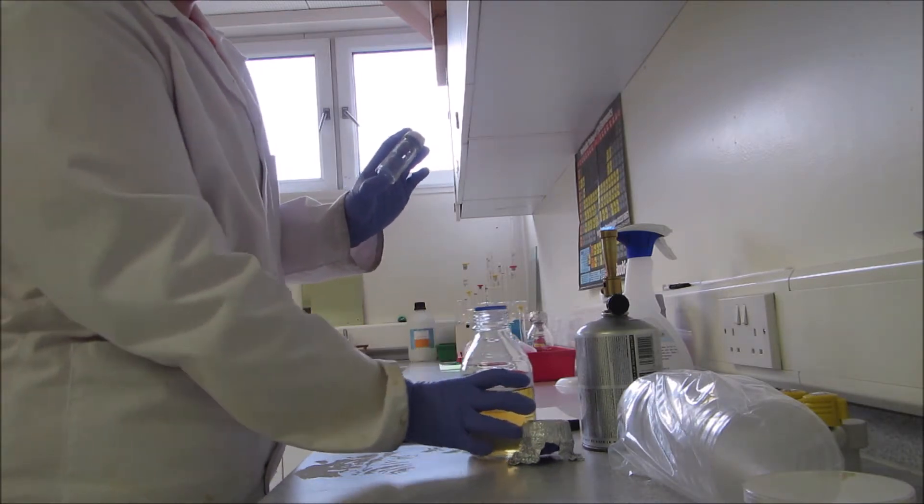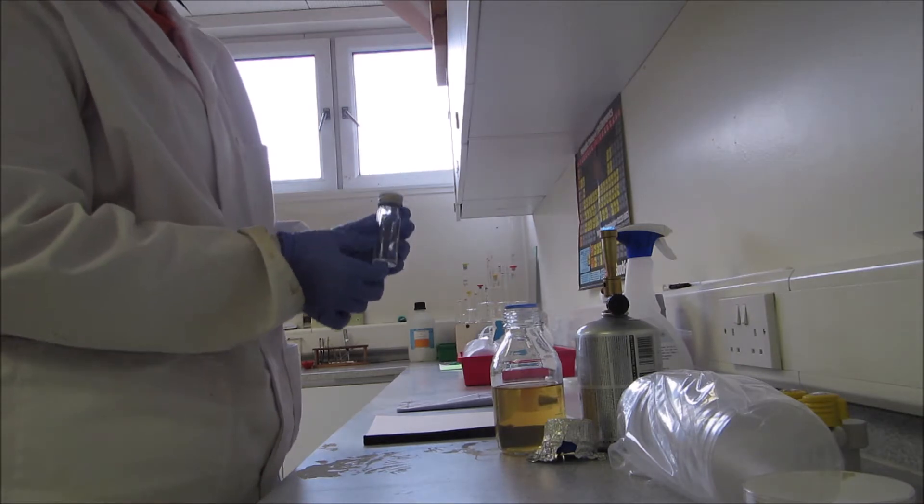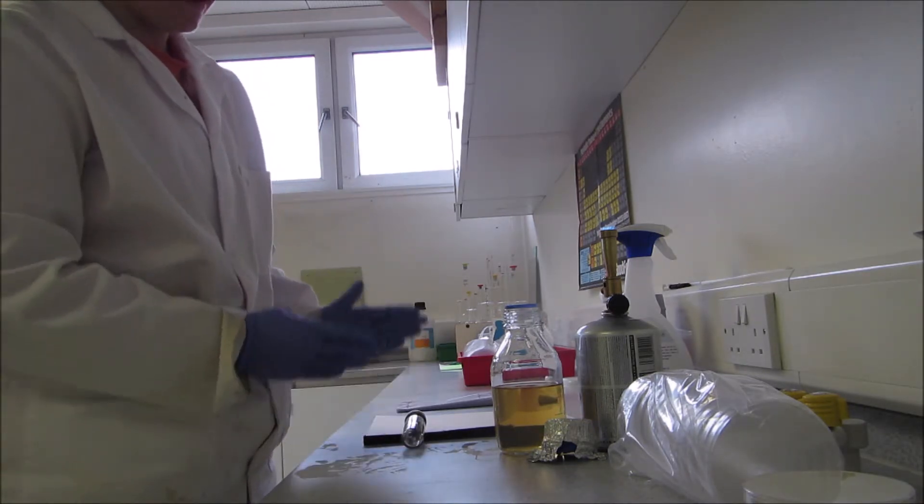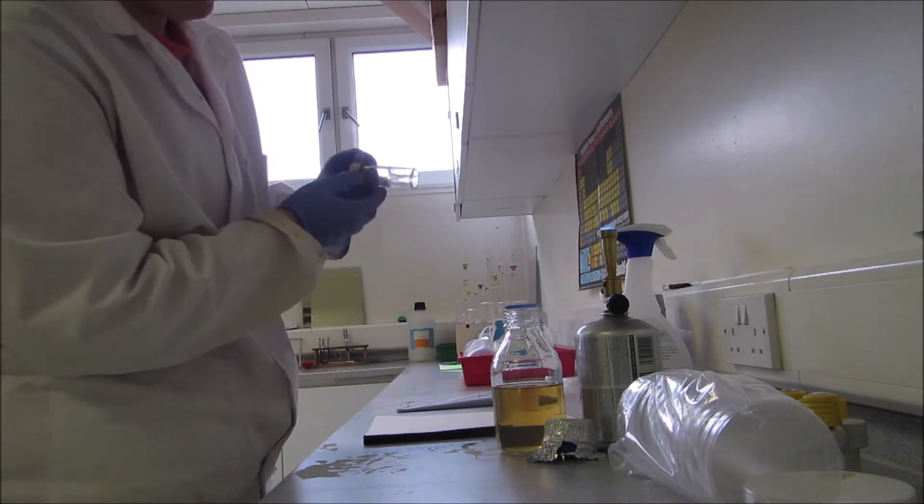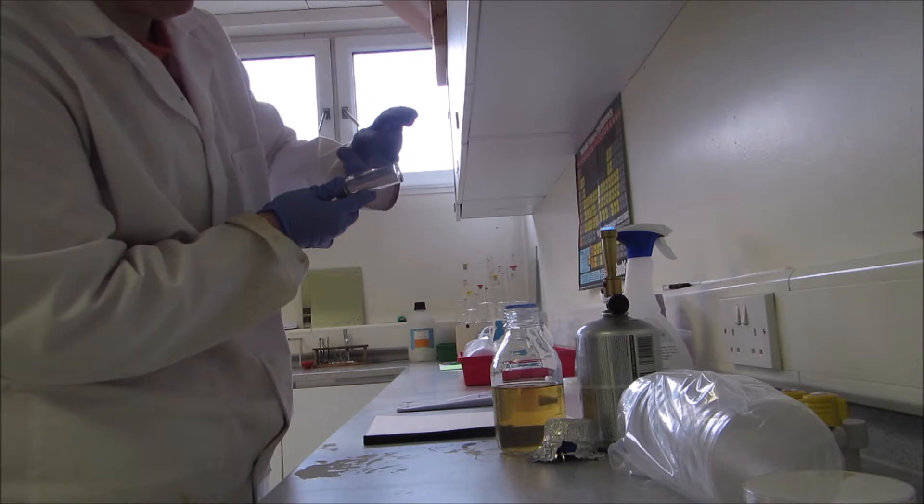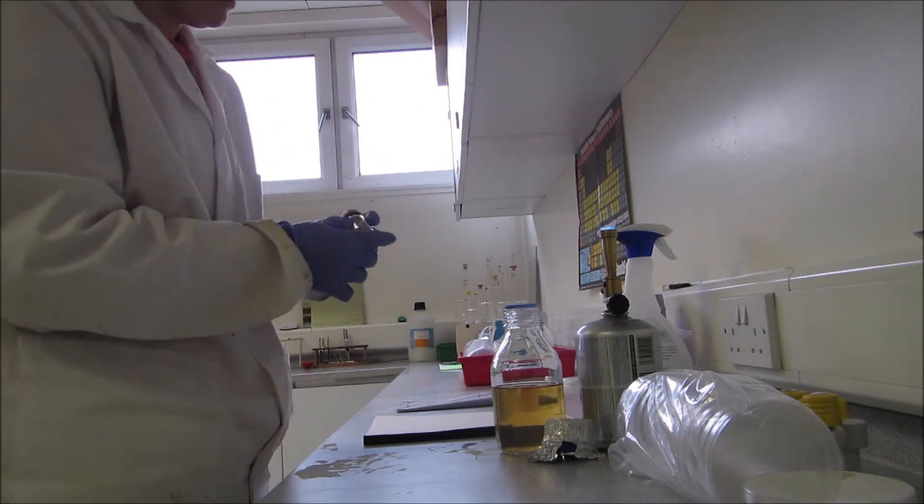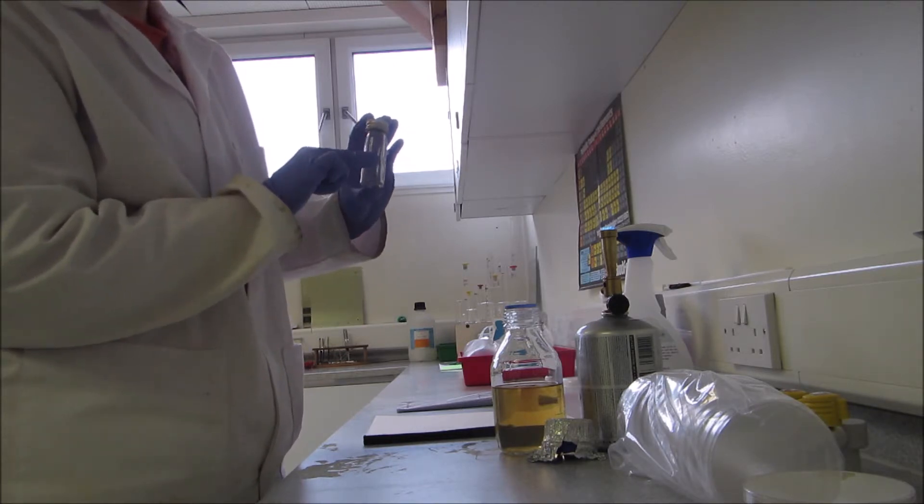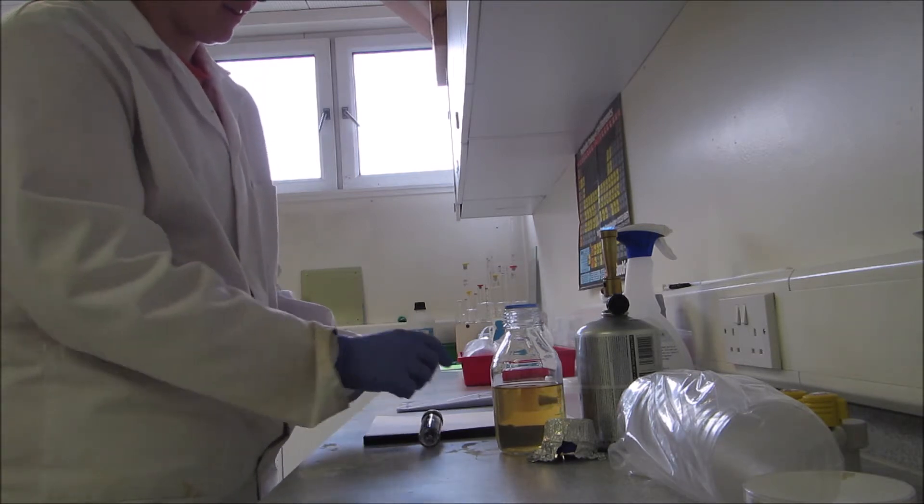When you first come to pour slope agars, I would pour in a known volume of deionized water and try to find a way to slant it so the agar will cover about a 45 degree angle from the bottom right up to just before where your lid is. I've worked this out before and I know I add about 10 milliliters, which is half full. Then I find a file block or paper works quite well to lean it against, and you leave them there until they've set.